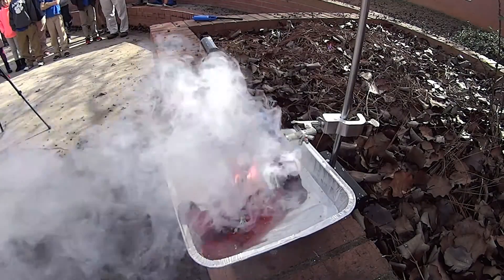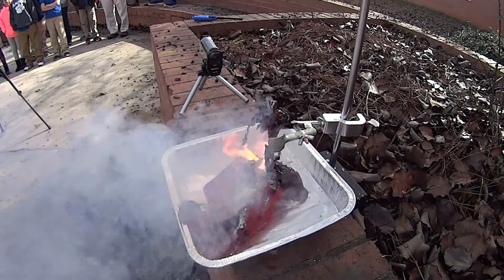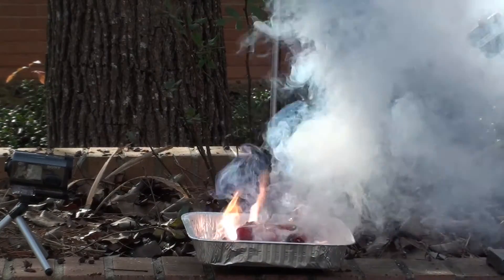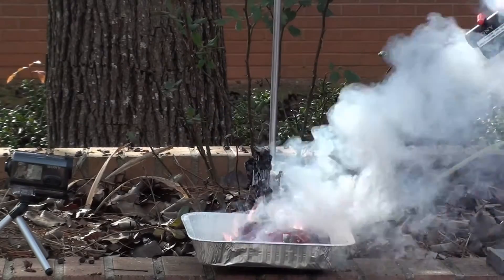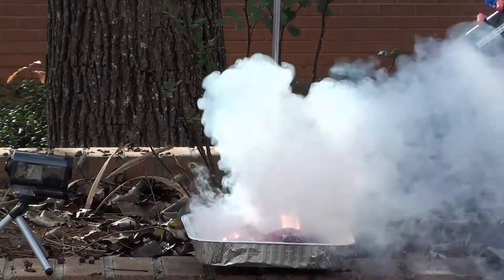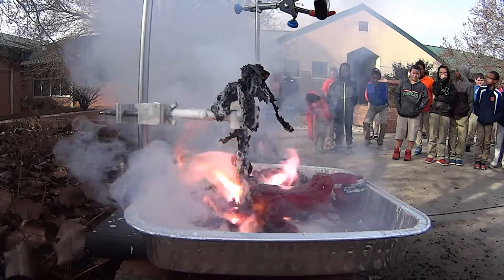Mr. Jones, the other one did better. Yeah, I think Gummy Bear needs to call his Life Alert at this point. We need to make a picture. Oh my God!